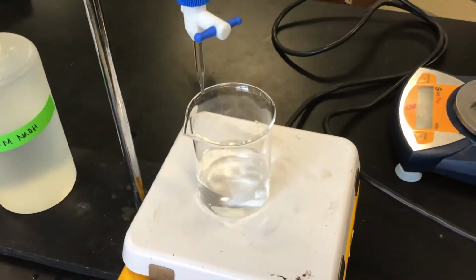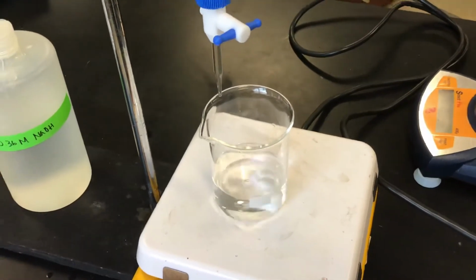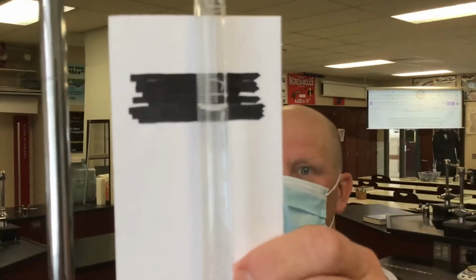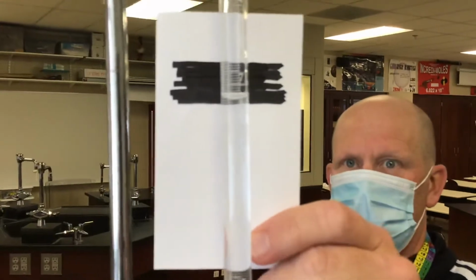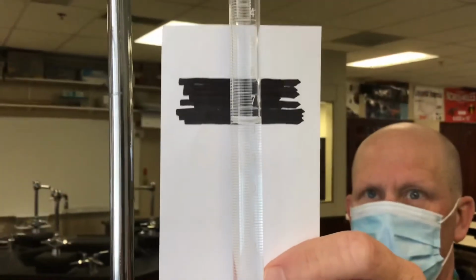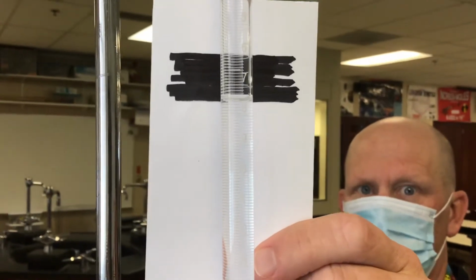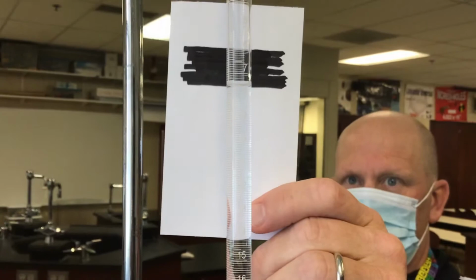Pause for card. To put behind here. Can we take the measurement? Does it show up pretty good? Should I move this one? Focus. Okay. There we go. We got the measurement? Yeah. Write that down in your notebook. Okay. I think we got it. I hope so.